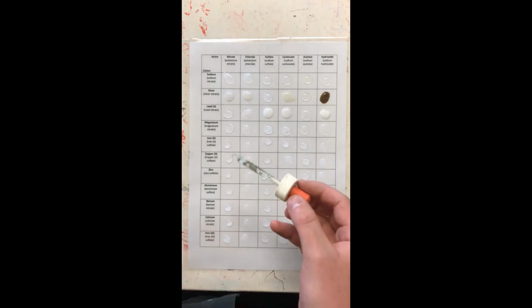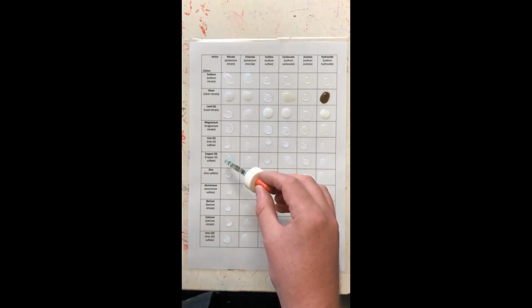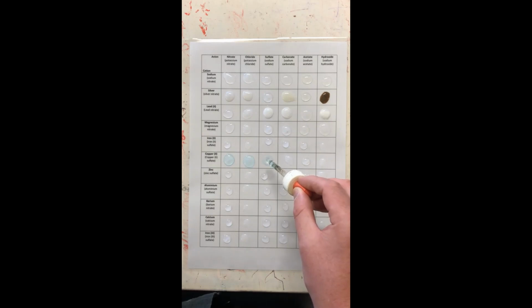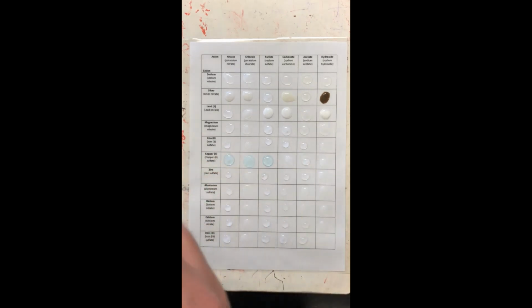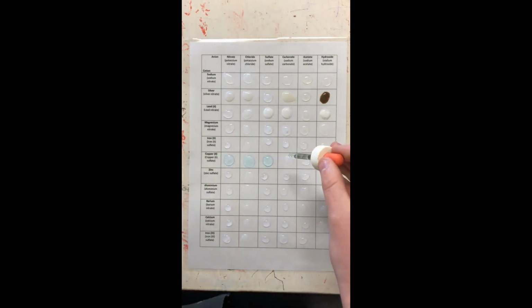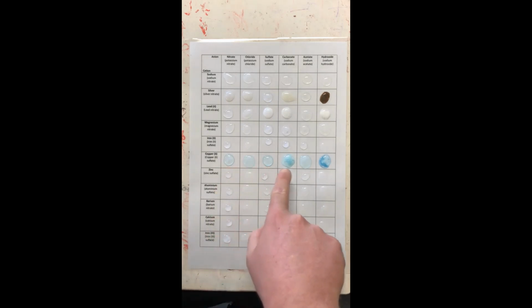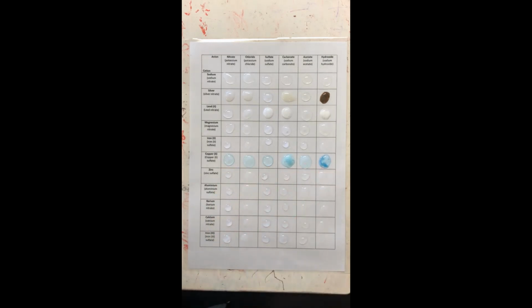So copper sulfate is going into copper nitrate. Now this is coming out a little bit blue, which shows you it has unfortunately already reacted a little. Oh no, it should come out blue. That's what it should be, don't worry. So it's blue in color, which shows it's dissolved. Oh, we get some lovely copper carbonate there, all right? Or copper hydroxide, have a look at that. So we've got some really cool colors there. So again, this one here is still colorless, precipitate, colorless, precipitate, all right?